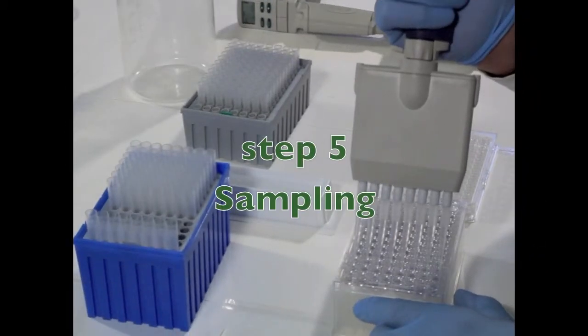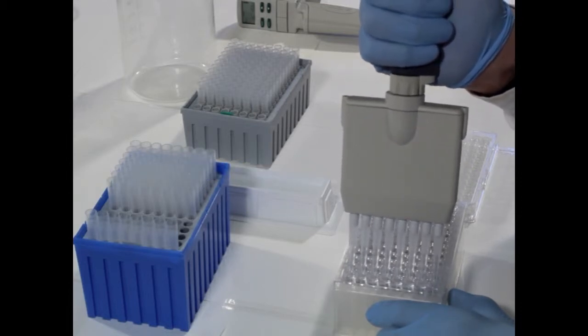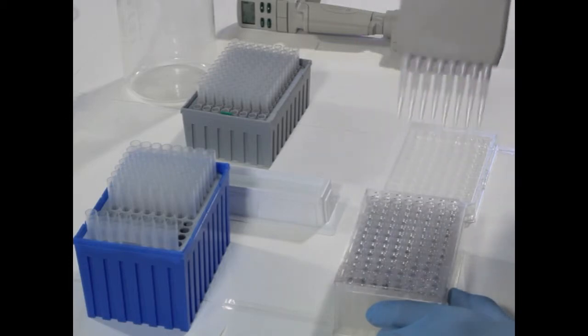Sampling can be done at customized incubation periods. This video demonstrates a study with four incubation times. Results of completely covered wells can provide reliable information.